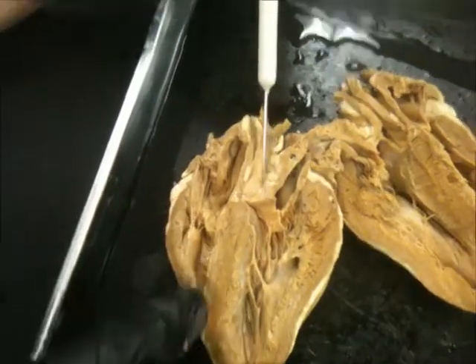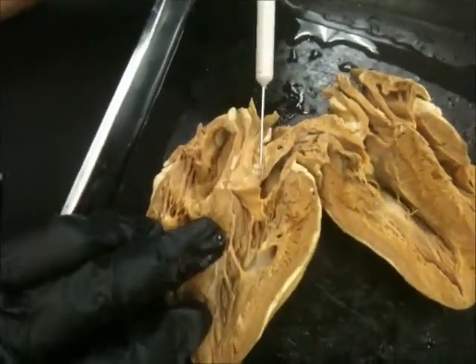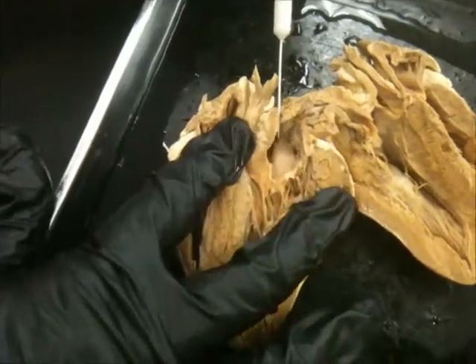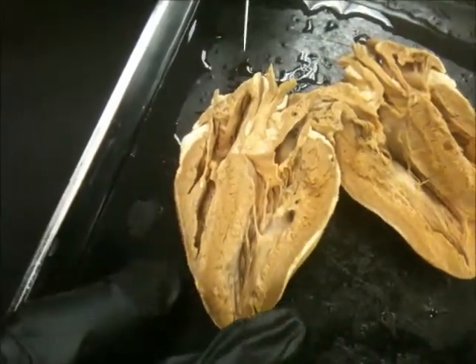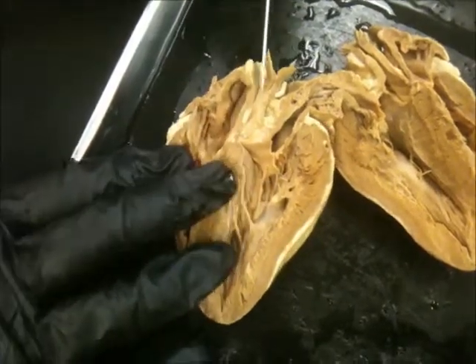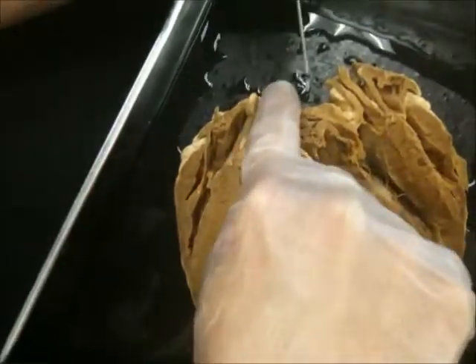And you know where the bicuspid valve is pumping blood? Where is it going? Down here to the ventricle — right, or the papillary muscles. So then we've got to look for the semilunar valves, which you're not going to find. But on the sheet is the aorta. We've got to find the aorta. The aorta's going to be in the center.